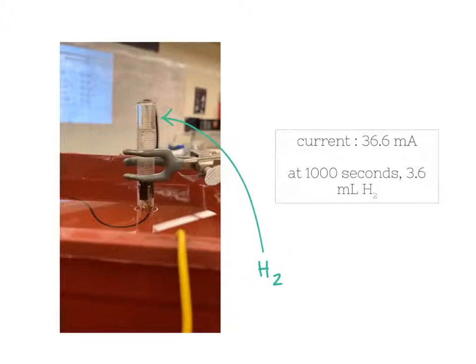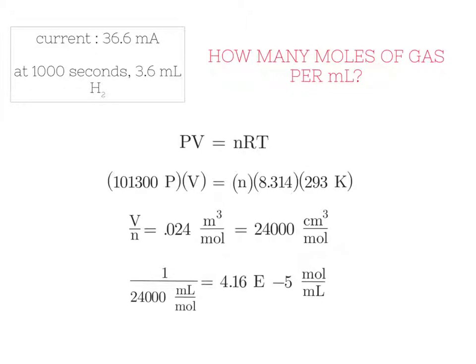We have 2 key pieces of data, that the current has stabilized to be 36.6 milliamps, and that at 1,000 seconds, we have 3.6 milliliters of H2 accumulated. So the first question we need to answer is, how many moles of gas are there per milliliter at the pressure and temperature we are conducting this experiment?